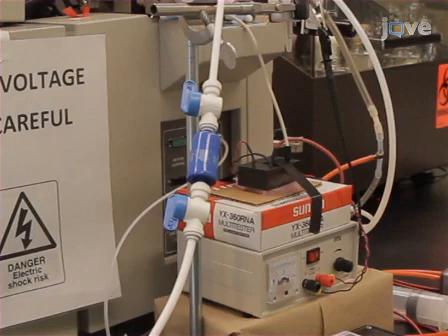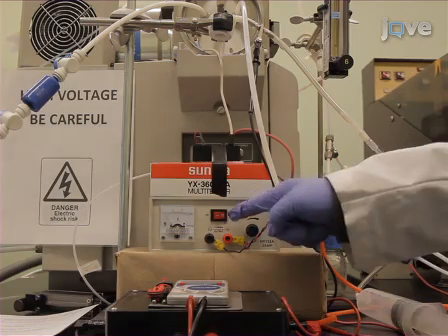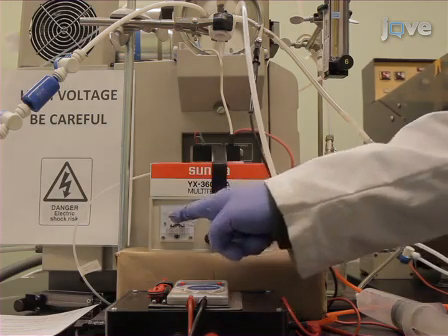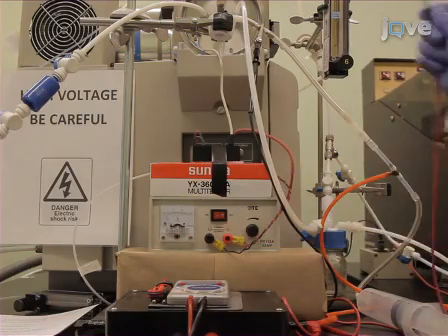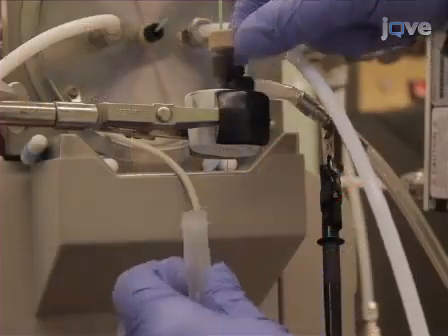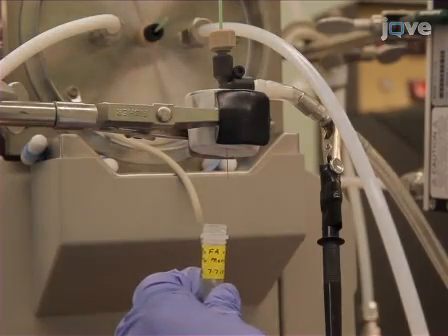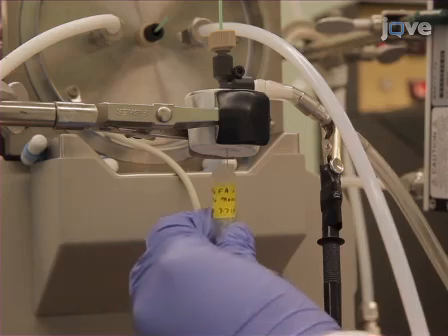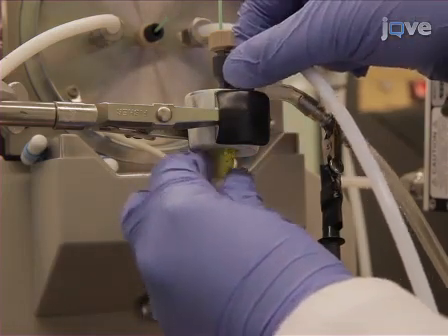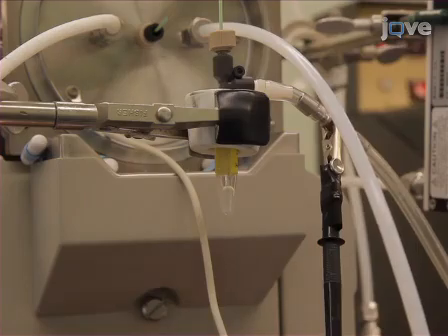The filters will not interfere with the transfer of volatiles to the SESI reaction chamber, but may slightly impact the efficiency of aerosol transfer. In order to verify that the voltage supply is turned off and that the system is discharged of electricity, check that the indicator lights on the voltage supply are off, ensure the voltage on the multimeter is 0, and ground the electrical leads. At this time, install the electrospray solution. For analysis in positive ion mode, we use an electrospray solution of 0.1% formic acid, 5% methanol, and 94.9% water in order to achieve optimal signal intensity and stability.